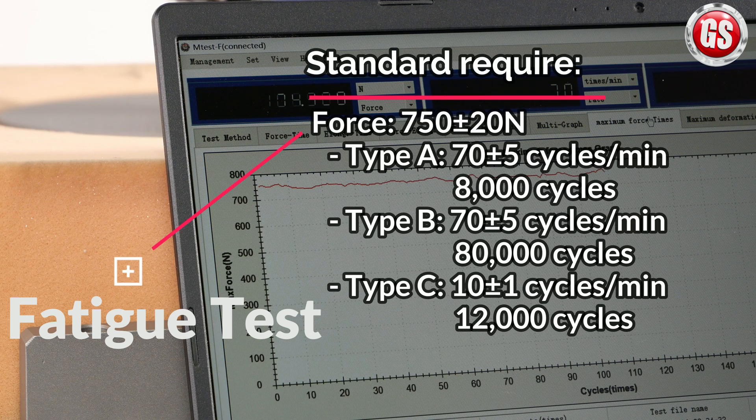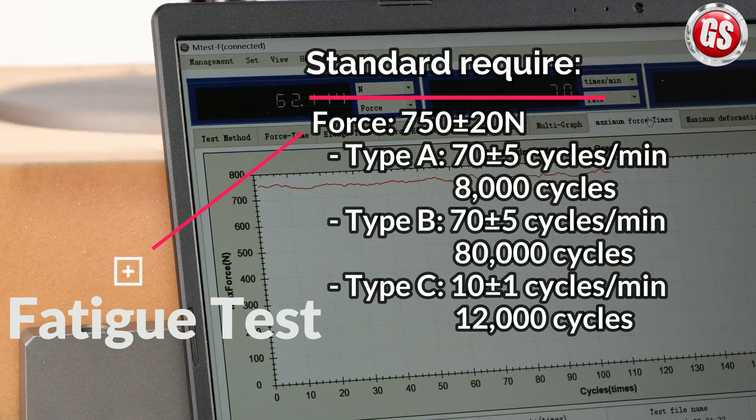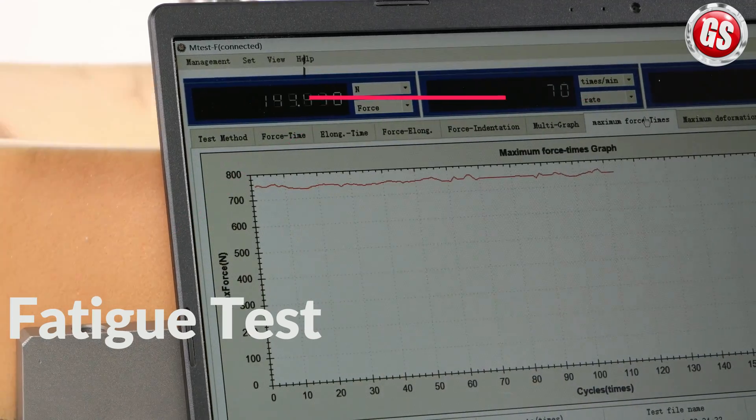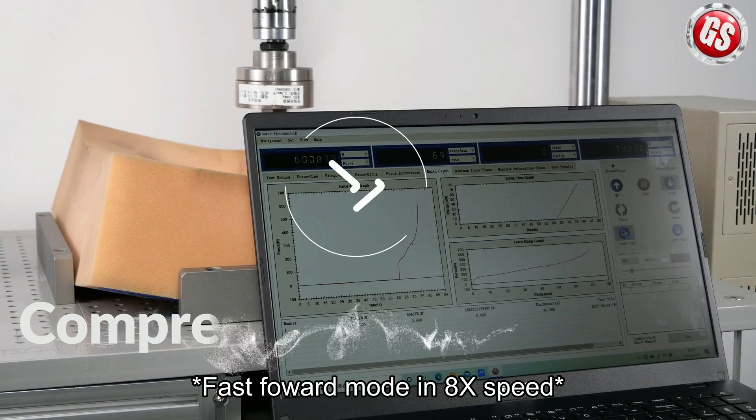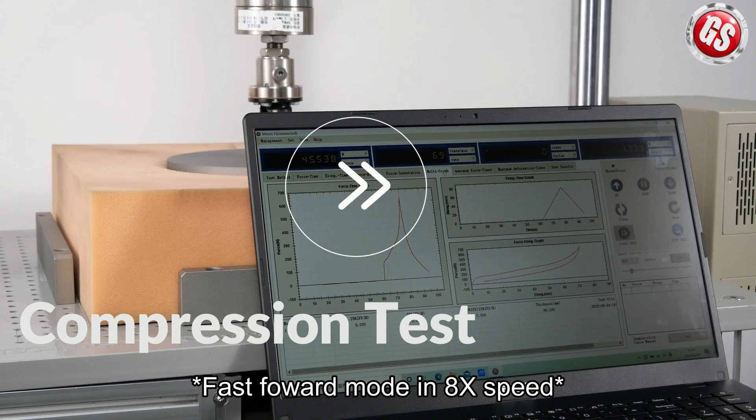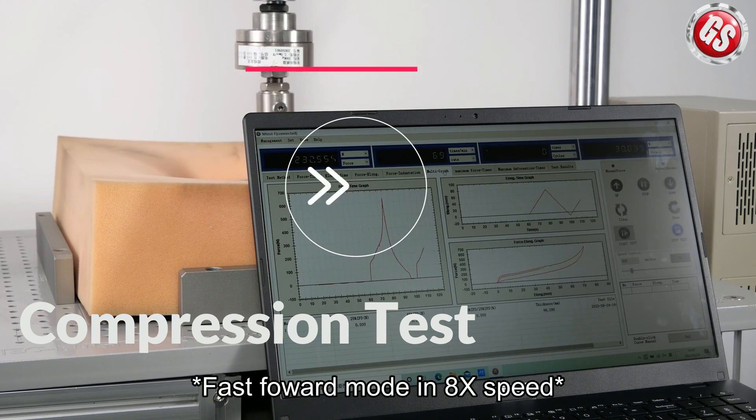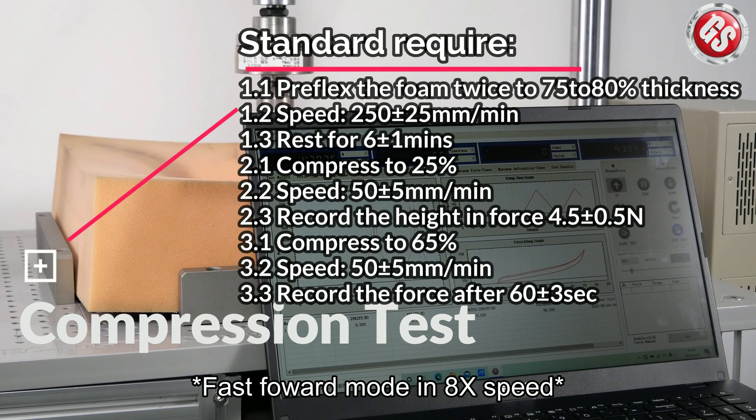Here is the testing requirement of different types of foam. Now is the compression hardness test in time lapse and the testing requirement of the compression test.